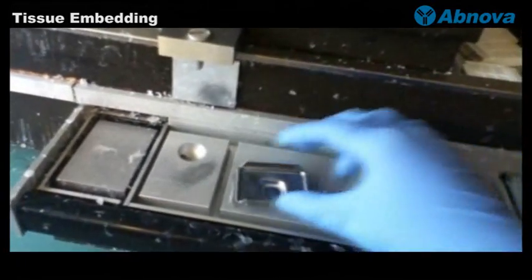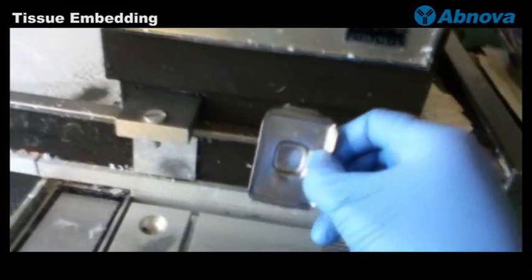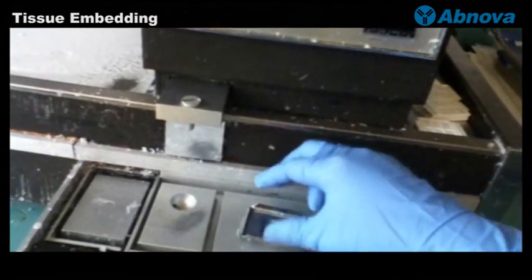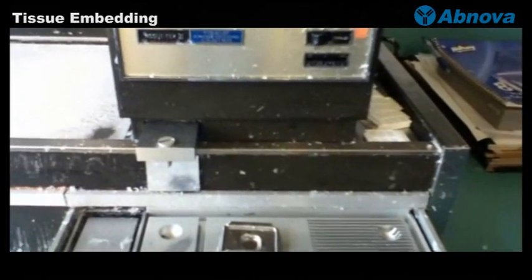Now we will get ready and find the right size metal mold, warm them, and get ready for the next embedding process.